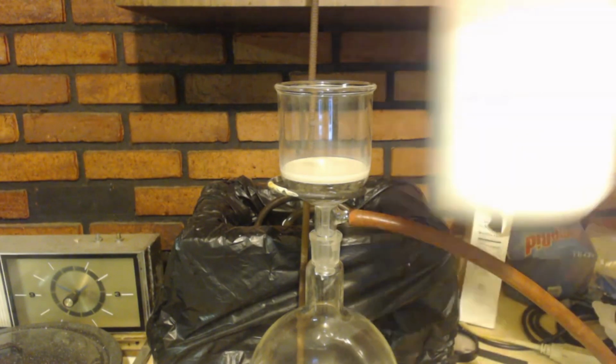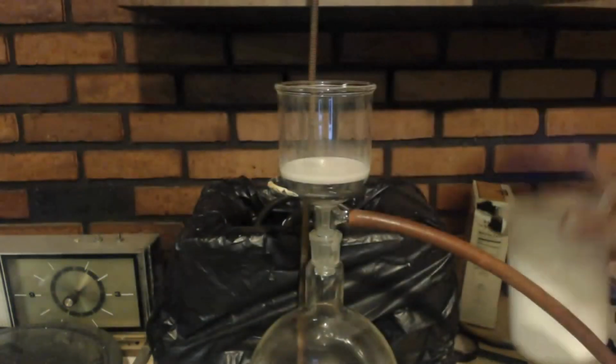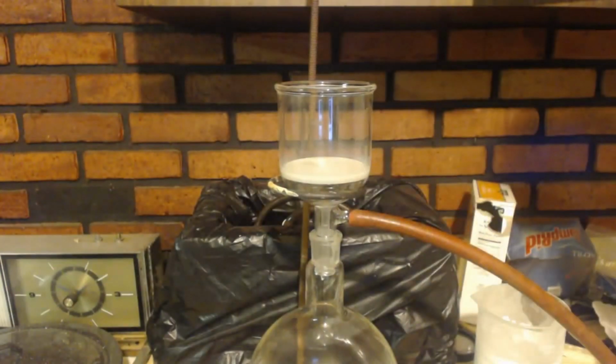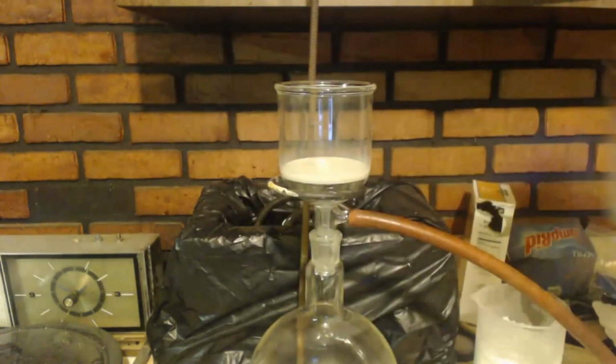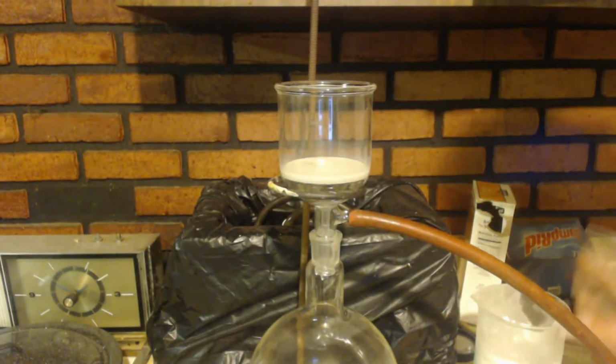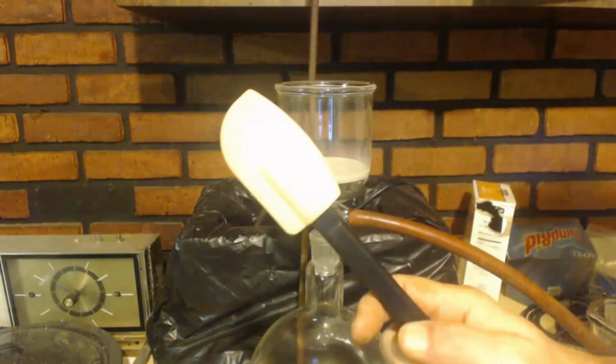Alright, I got my benzoic acid. It's in the water still. Put it in the freezer for a while. Got some ice cold water, about a liter almost. And I got my filter. And of course this.